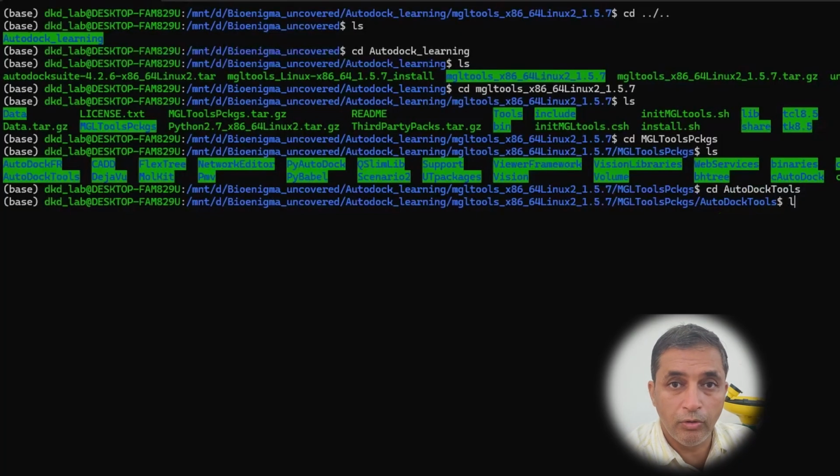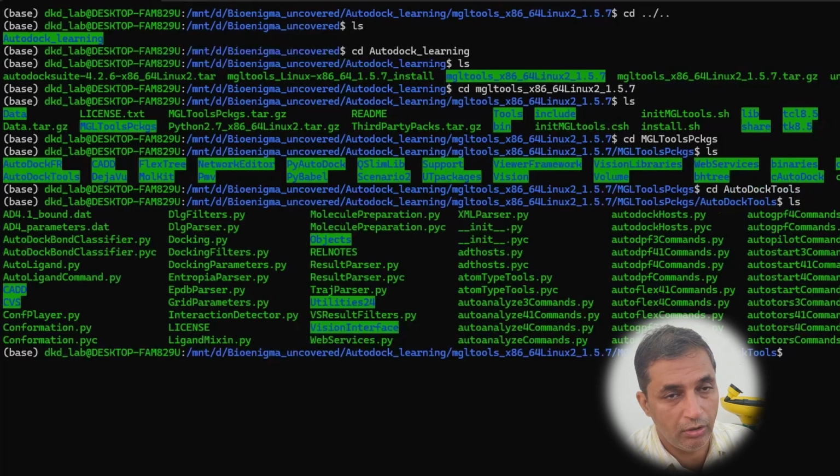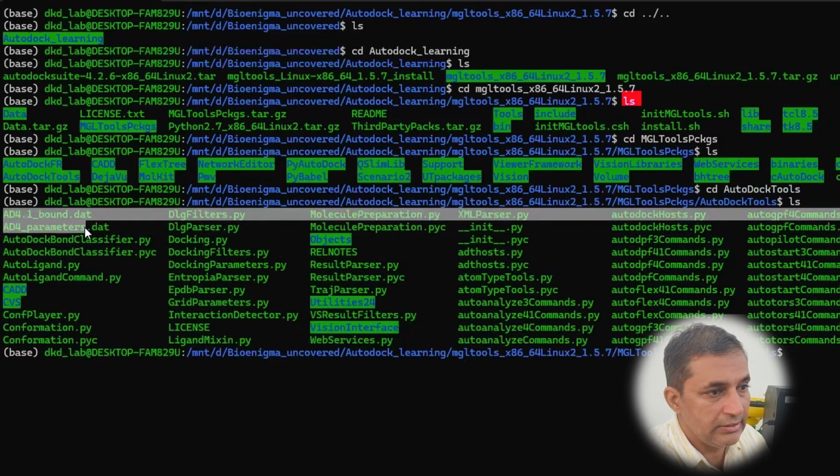Now before proceeding further, we need to establish 100% that our MGL tools installation is completely successful or not. Moving forward without this verification can be troublesome. So we are going to type some commands and look into all the folders which will help us in verification of this installation process. Again, we are going to look into this MGL tools folder, type the ls command.